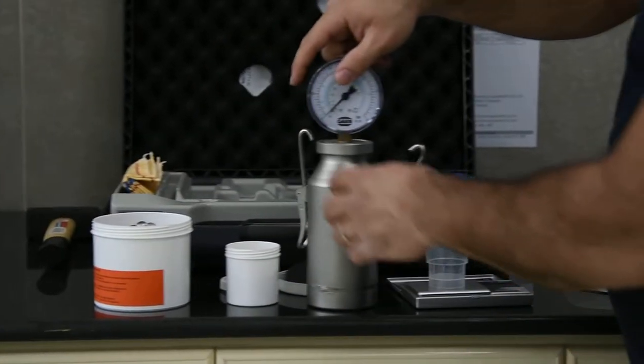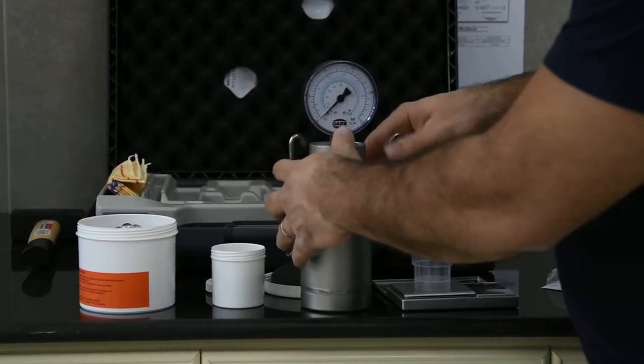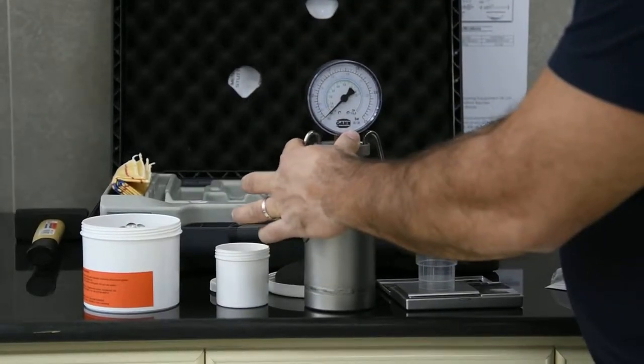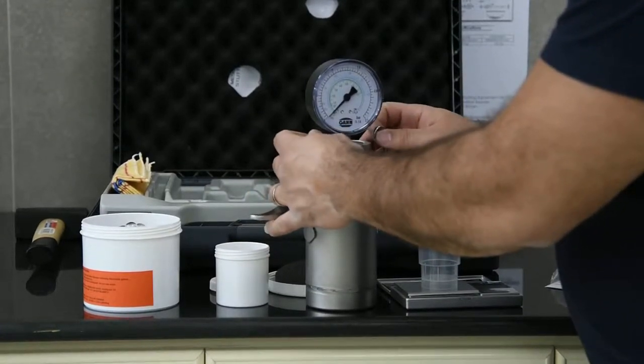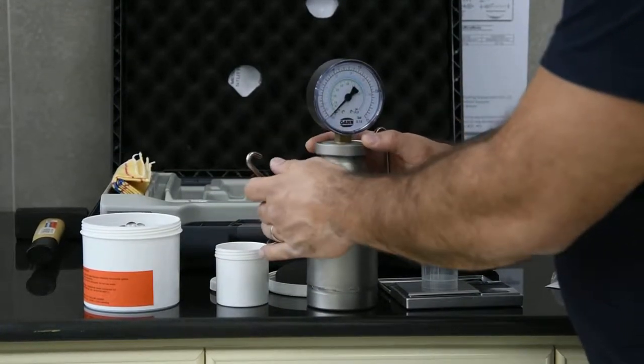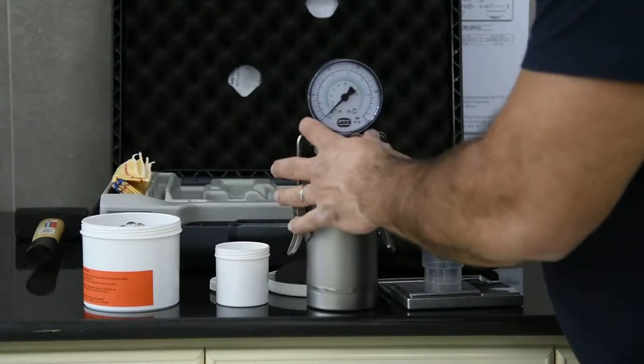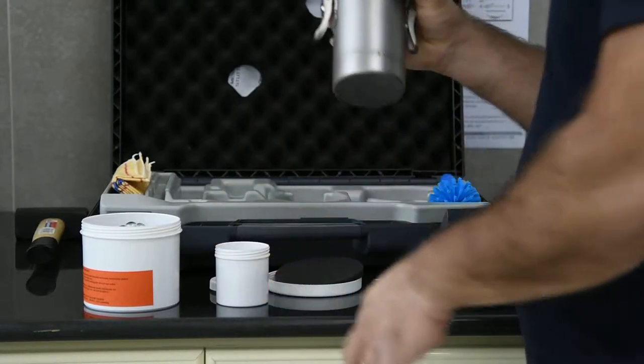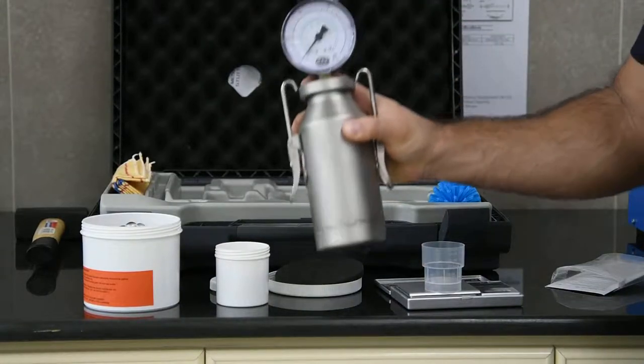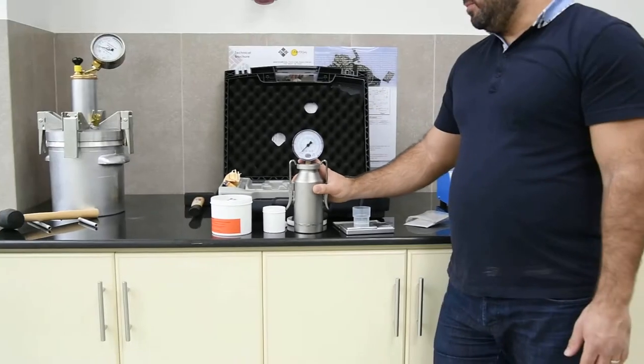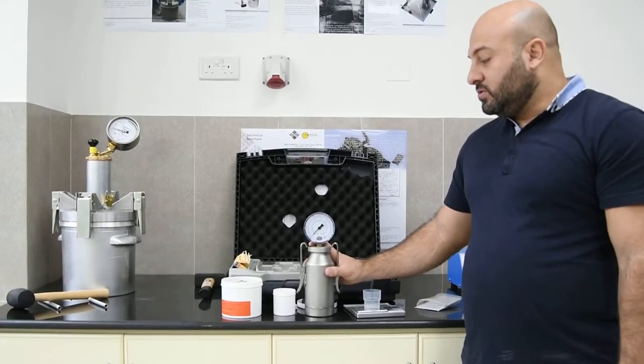With this step you will need to close the jar properly with both arms and then all you have to do is shake the jar. The steel balls will then break the glass capsules and release the calcium carbide embedded inside the capsule.